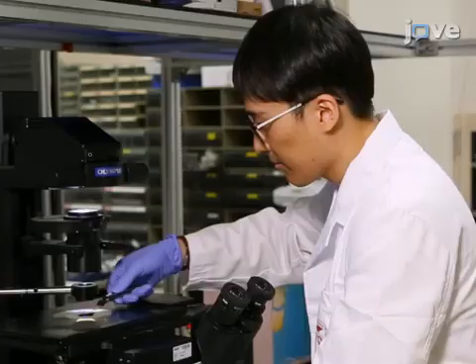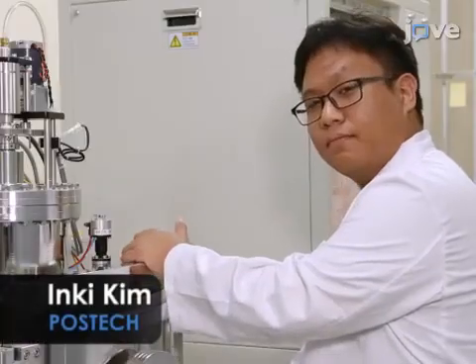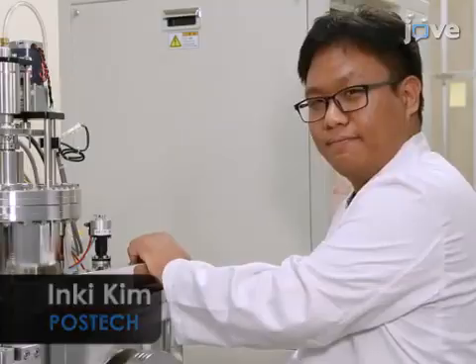The main advantage of the spherical hyperlens is that it can magnify two-dimensional information at visible frequencies. A spherical hyperlens can also be easily integrated to the conventional microscopy without additional complex system. Demonstrating the procedure will be Dasol Lee and Inki Kim, who are graduate students of my laboratory.